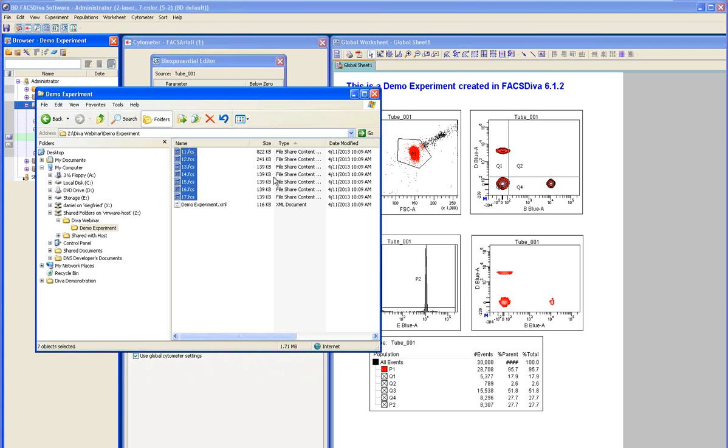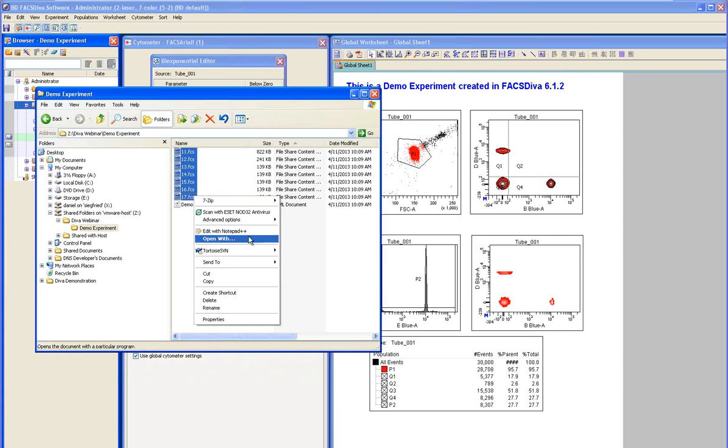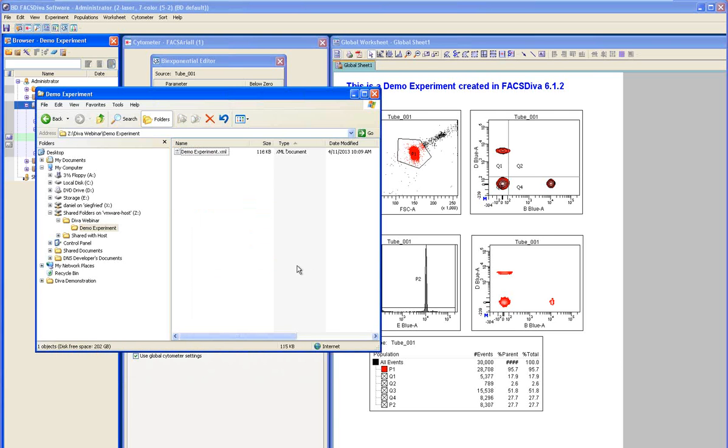There is a problem in that when Diva exports the data files together with the experiment, the data files can't be used by anyone other than Diva. So this is a problem. This has been a problem for us and for other third-party software. And after working quite a bit with the Diva team, we've decided to specifically exclude these files. Now you can use them in FCS Express, but there are several problems. And as I delete them, I'll tell you what those are.